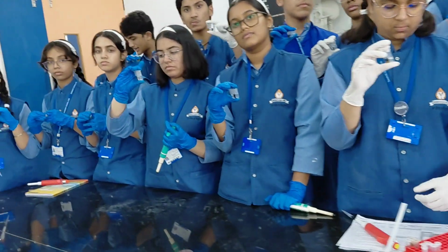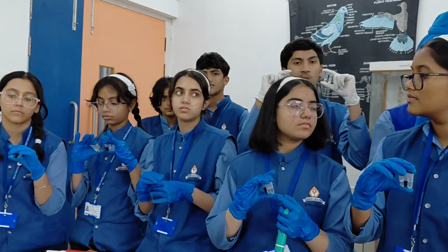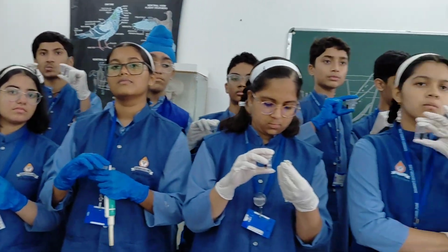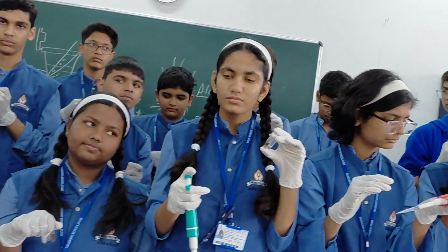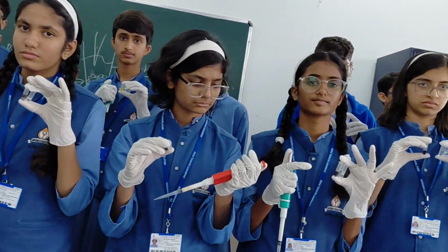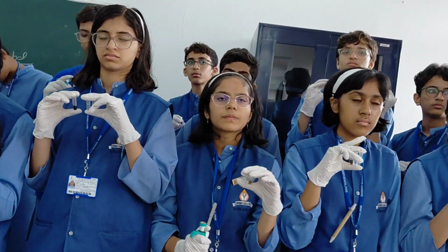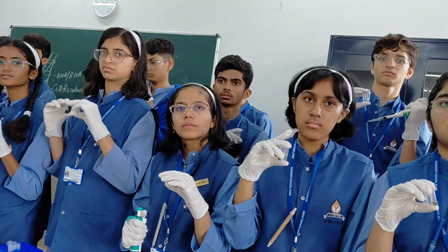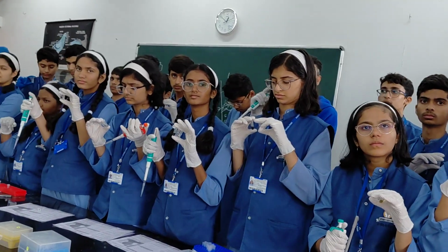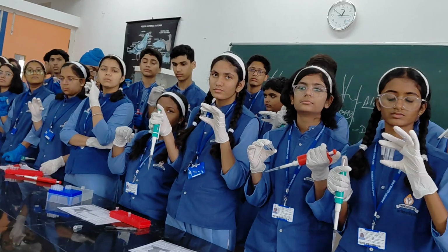Along with that, a small quantity of DNA loading dye and ethidium bromide is used to stain the DNA. The DNA loading dye just helps to load the sample, while ethidium attaches to the DNA in the gel and gives illumination once you expose it to UV light. In that UV exposure, you take all the pictures of DNA. Those are the pictures you see in DNA fingerprinting, sequencing and so on.